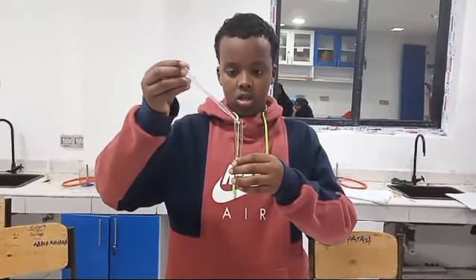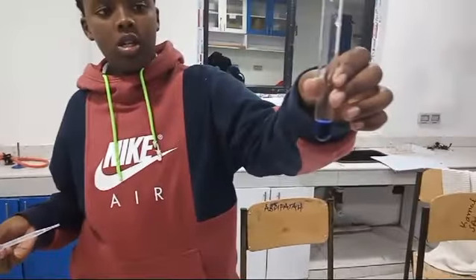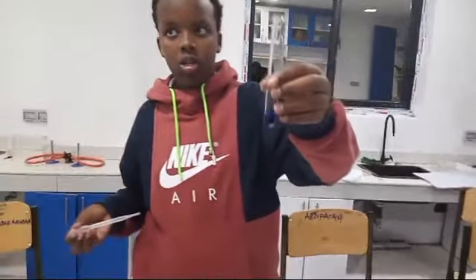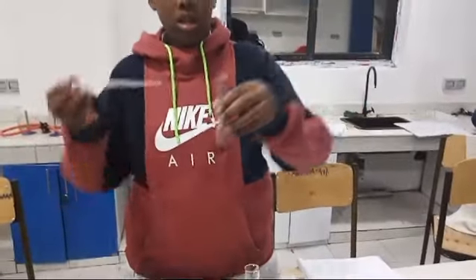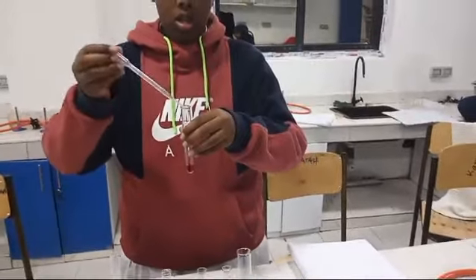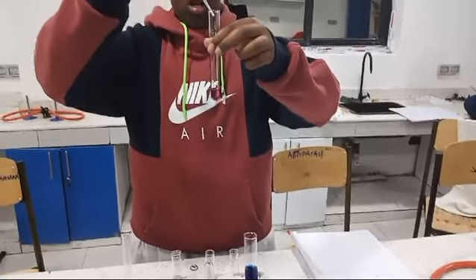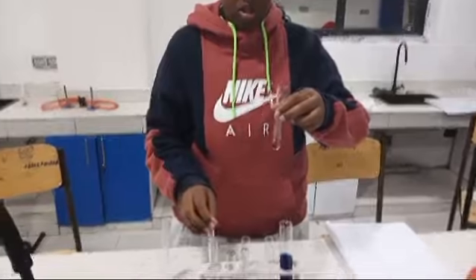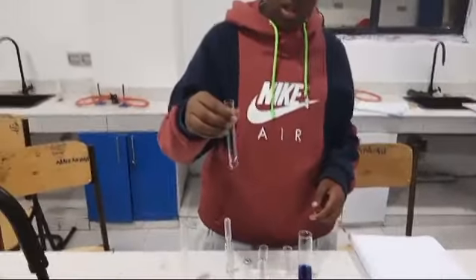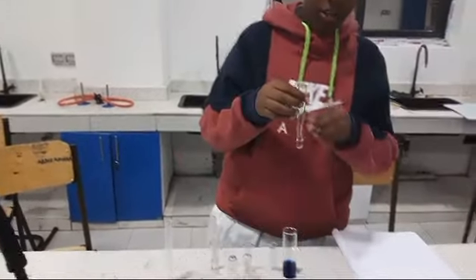Let us see this paper first. Hold it so that it can be seen. Then add so that we can see what is changing, what is happening. Add. Then after adding, what are you supposed to do? Shake it. Shake it. And now the color has changed to a visible color.